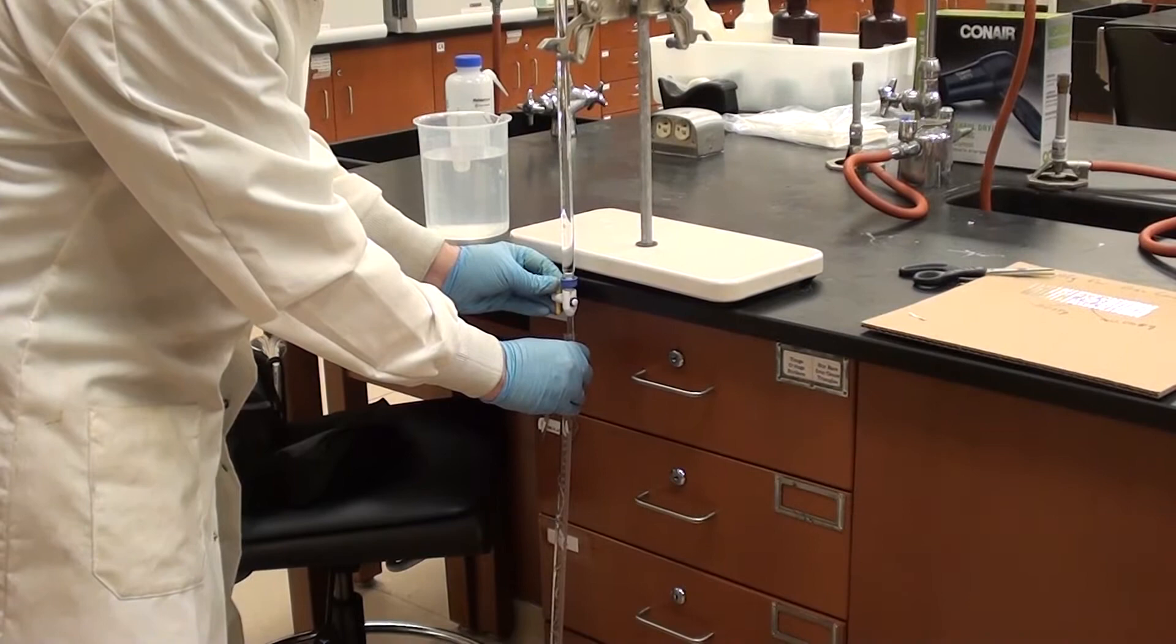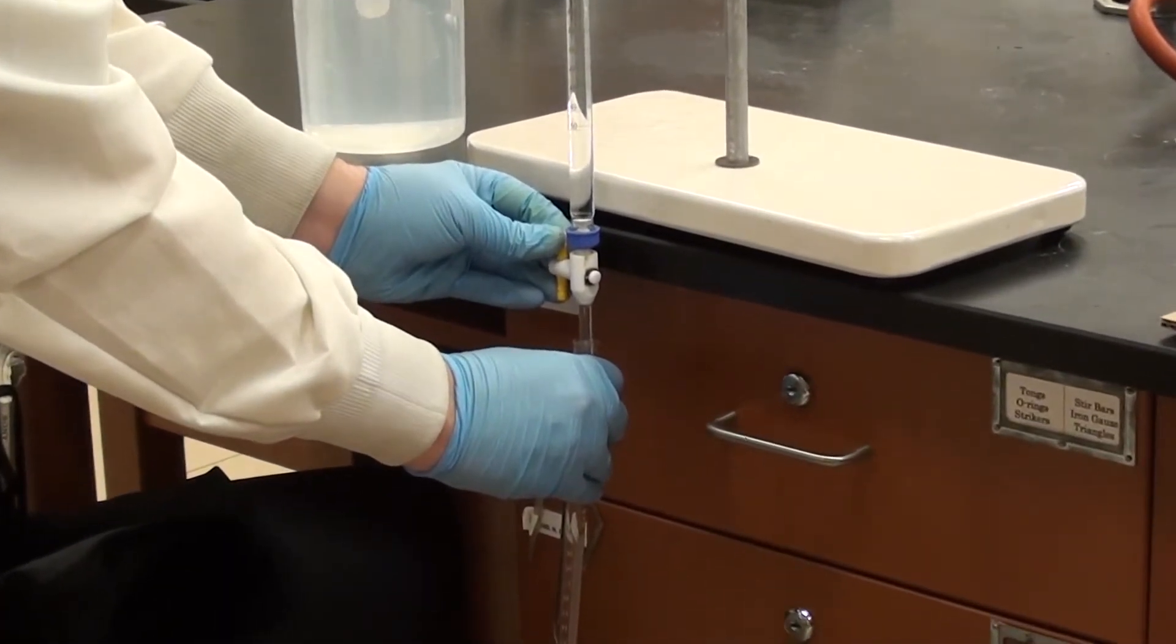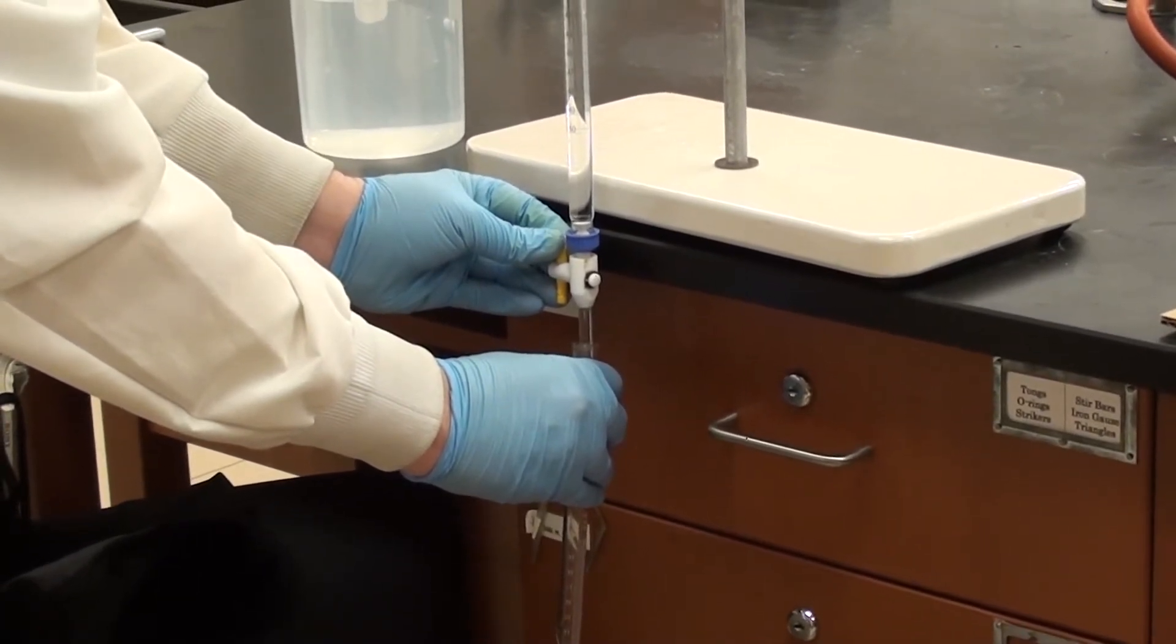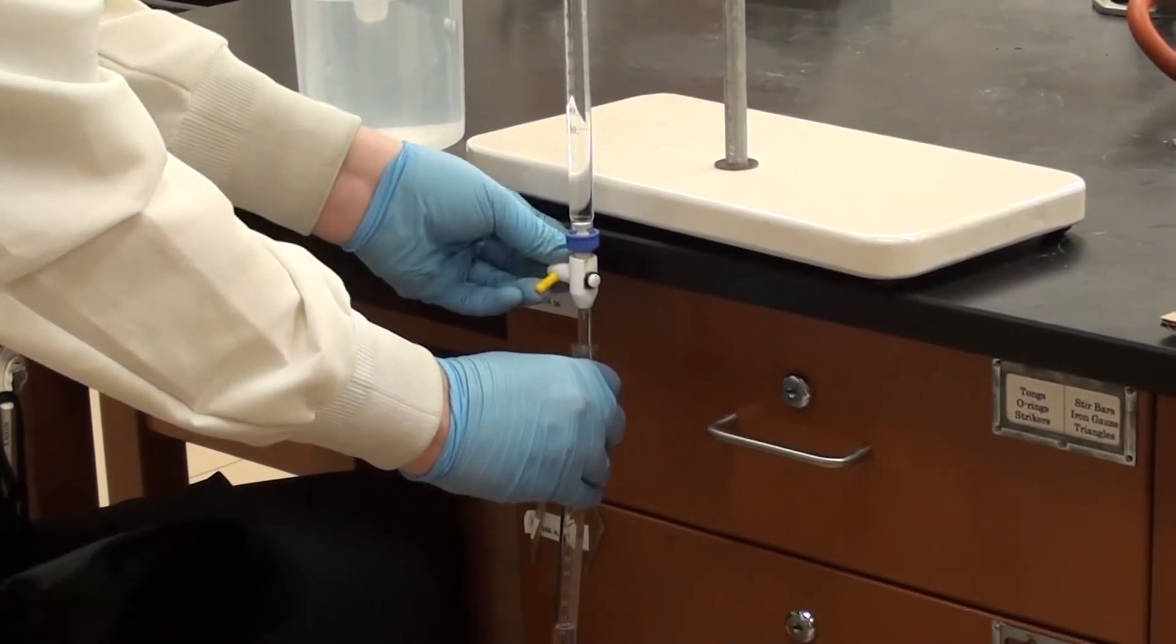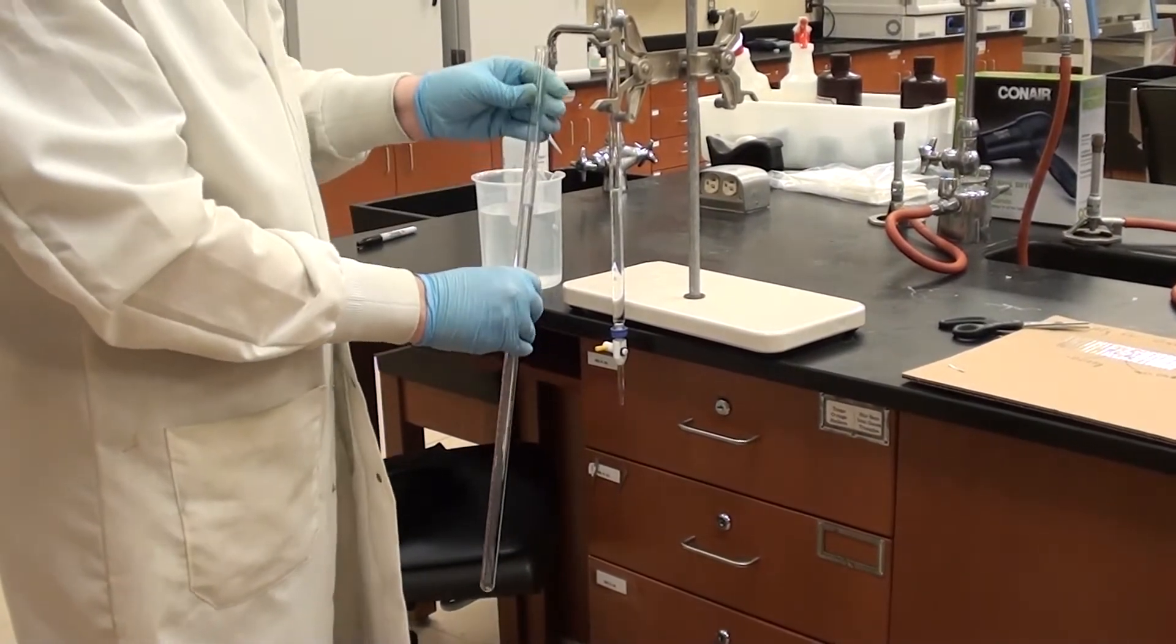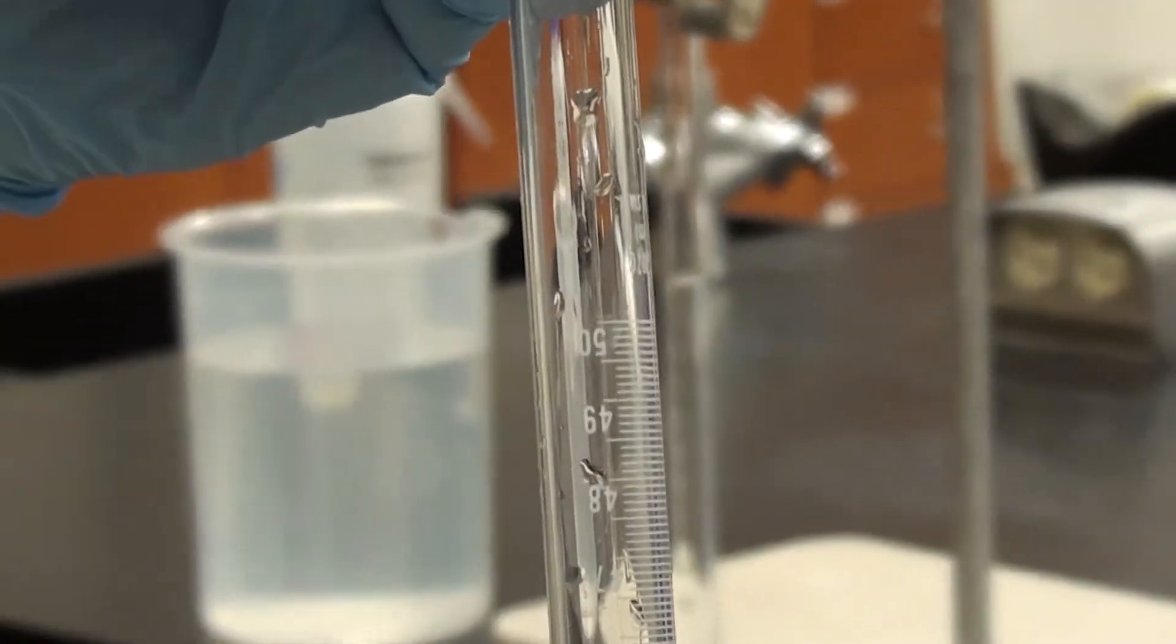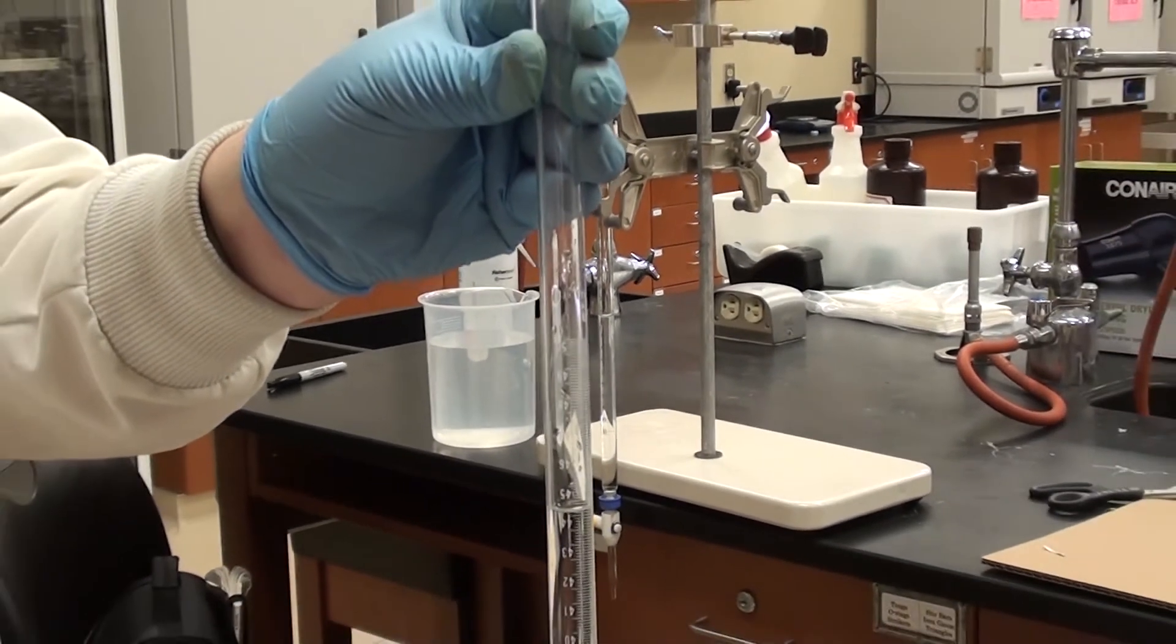Now what I'm adding from the burette is exact. There's no doubt about that. But what's going into the eudiometer tube is not particularly exact. This is how we're going to calculate what's called the conversion factor to take account of the fact that the eudiometer tube is not correctly graduated. Alright, so I've added about 40 mils now. I will read the exact number off there and that will be what I've put there. And then what I'll do is I will read off here what the eudiometer tube is actually saying. Now I know it's upside down but you should still be able to get a measurement based on that. Obviously if you try and turn it the right way up all the water will come out.